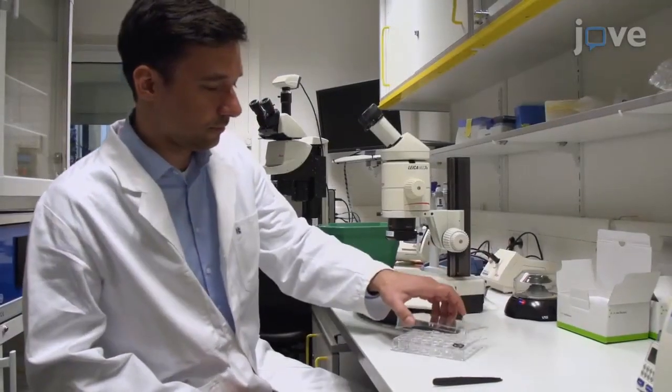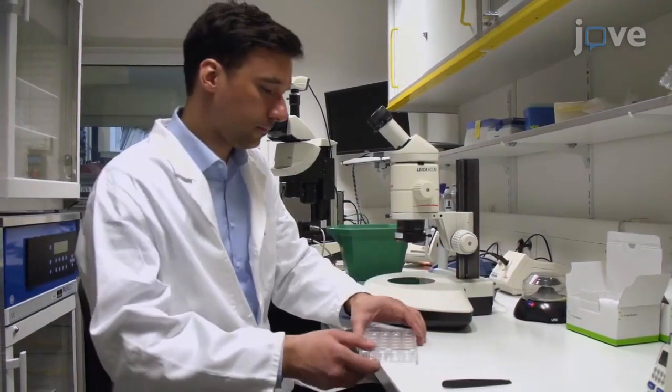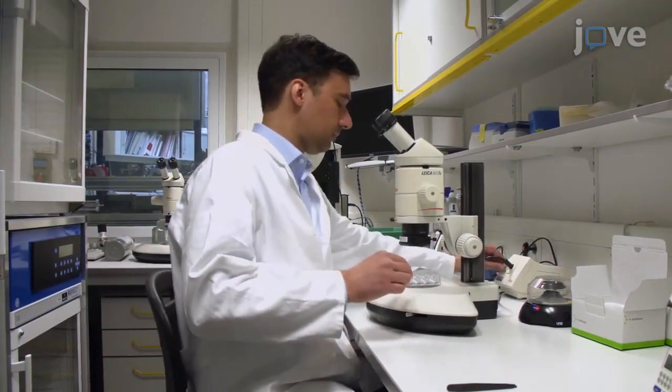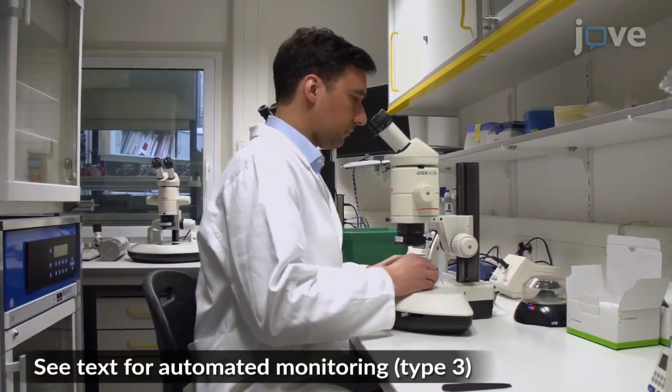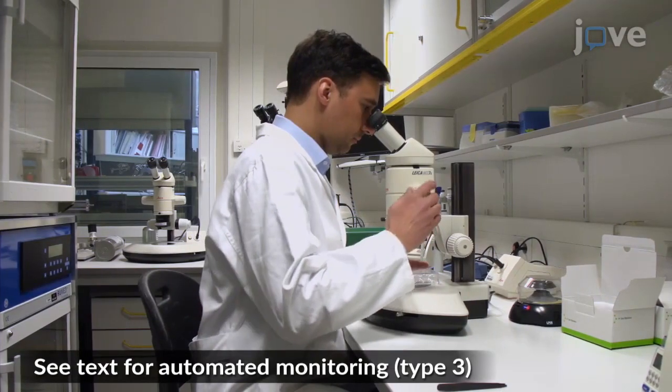By placing the crystallization plate under a transmission light microscope, with or without polarizers, monitor crystal growth without any disturbance of the experiment.